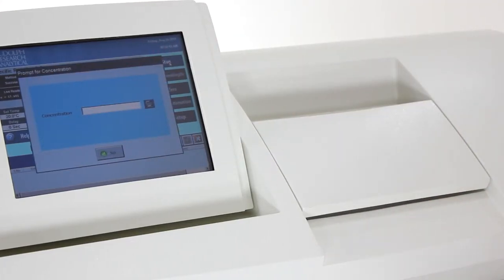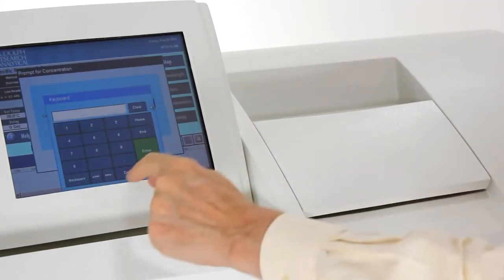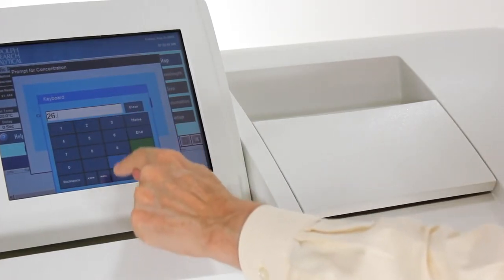The instrument is now going to ask me for the concentration. I key in the concentration that I've made the sample to.